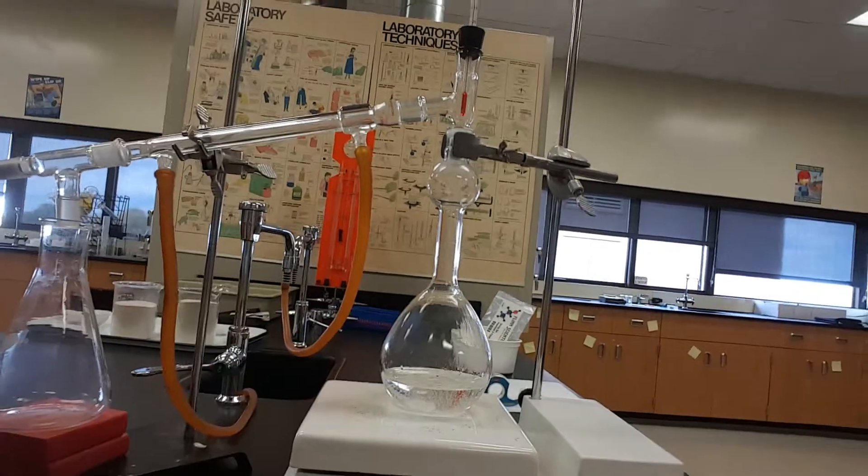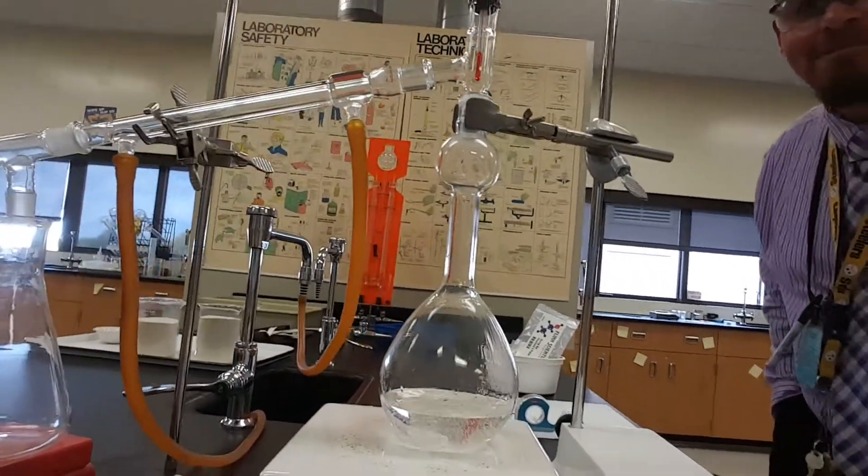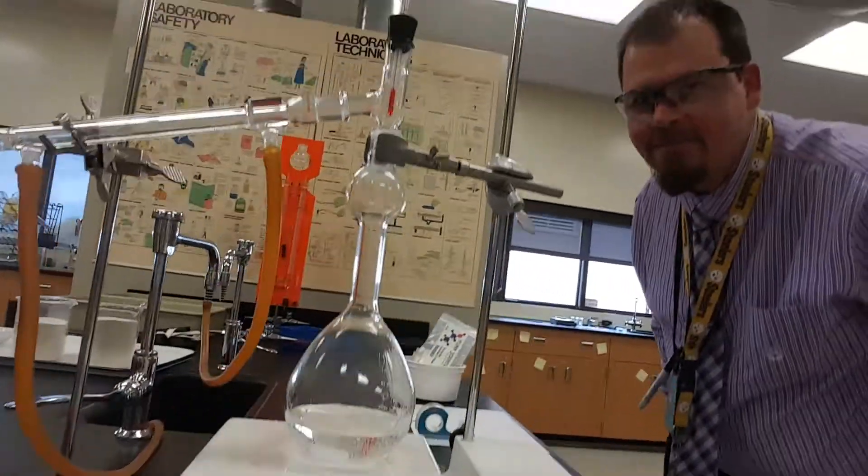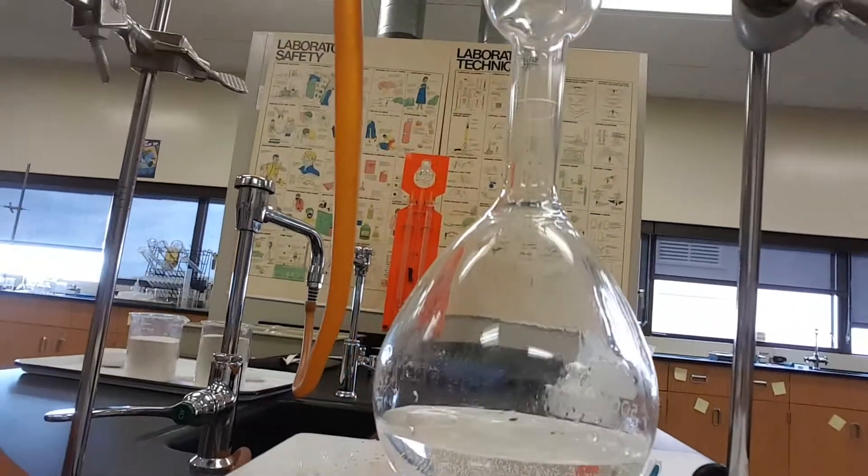We got ourselves a distillation happening over here. Just got started. I got the stir plate zipping around. I got the flask in here.